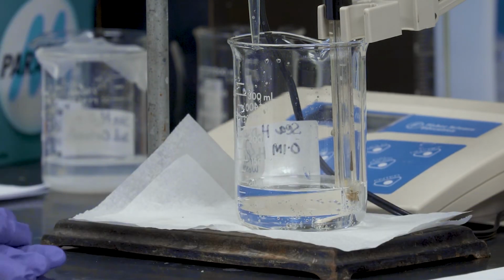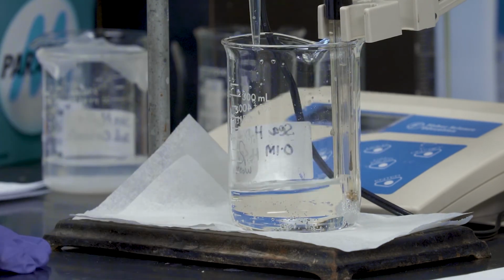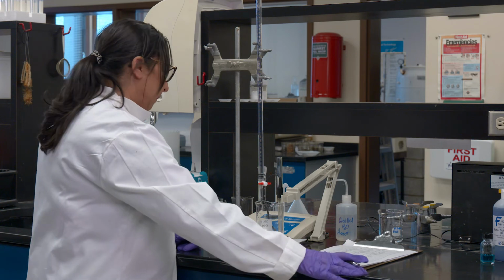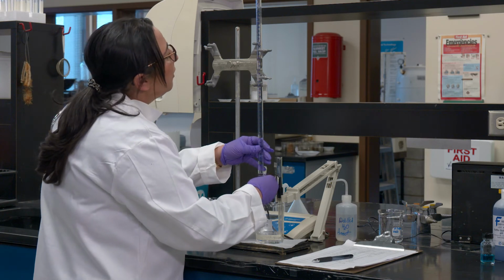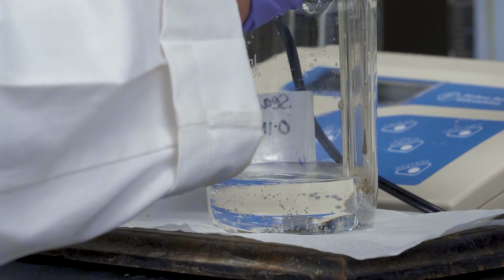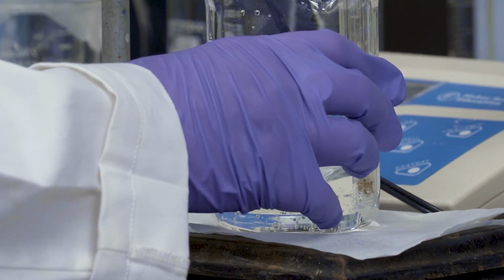Okay, this time, you know what, I have reached this far, and I don't want to take any chances of increasing or decreasing the amount of acid I'm adding in my solution, because I don't want to miss my second equivalence point. Okay, looks good. I'm at 5.25, and this is where a lot of change will happen. So from 5.5 till we hit 3 or below 3, it's going to be quick. And this is where you are hitting your second equivalence point, by the way.